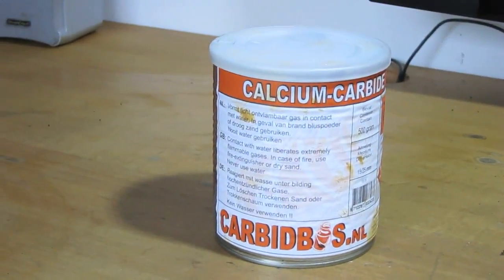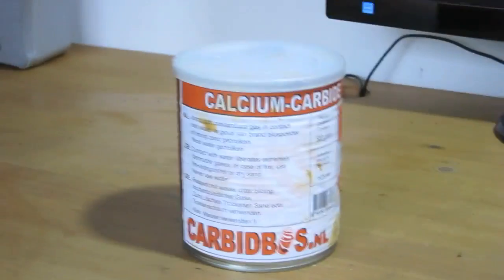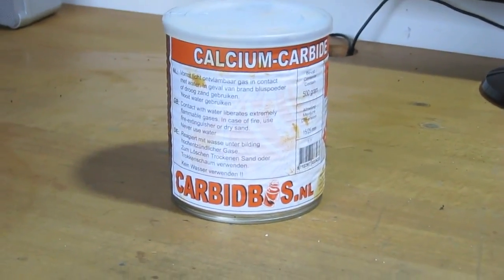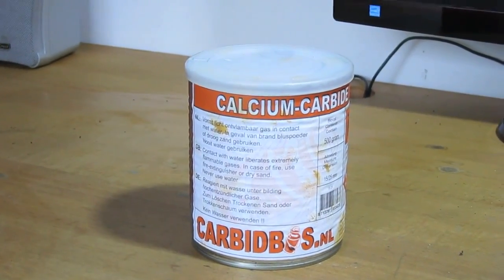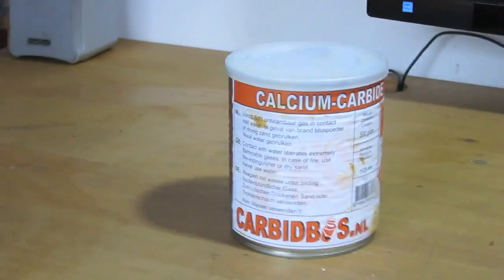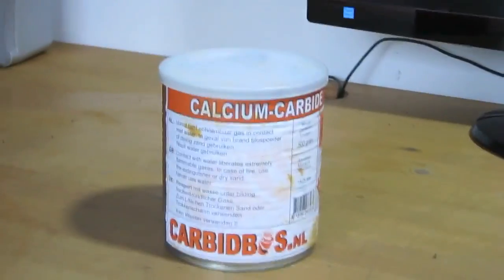This is commercially available, hardware store grade calcium carbide used for fun during New Year's Eve. I bought this in the hardware shop, but now I'm not going to use this one. I'm going to make it myself.